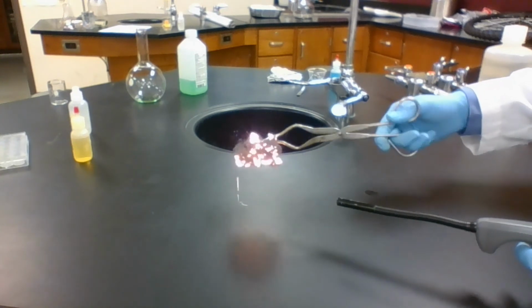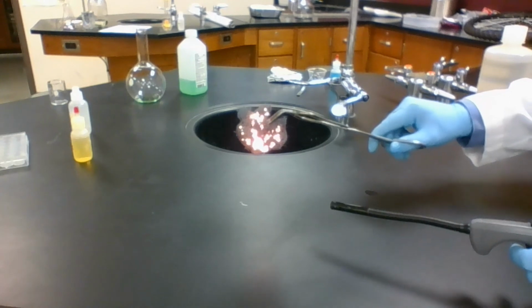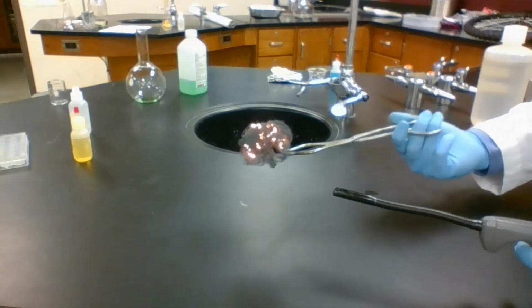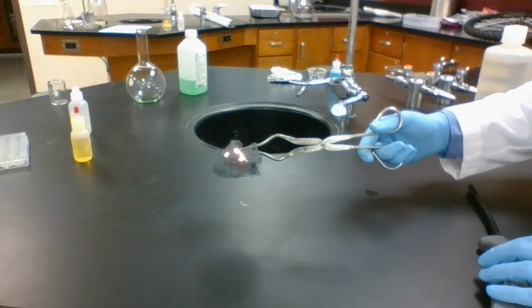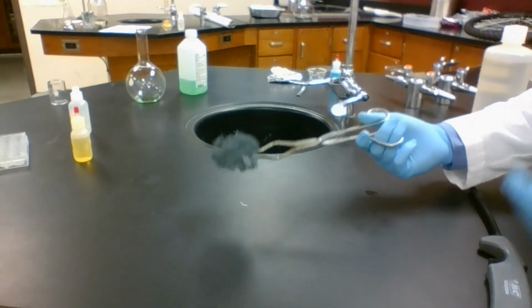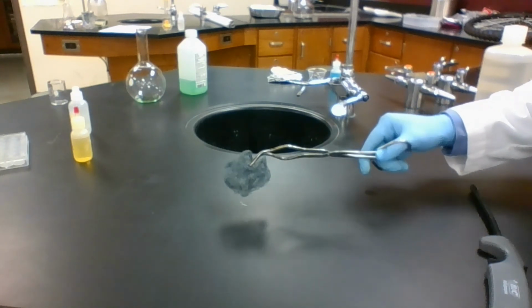Now this reaction really demonstrates why it's important to look at the reaction equation, because with the lighter involved and with the way this looks, you would almost certainly guess this is a combustion reaction. After all, there's O2 involved also. However, if you look at the reaction equation, we don't have any C's or H's here. So this can't be a combustion reaction. So be careful on what you pick for your reaction type.